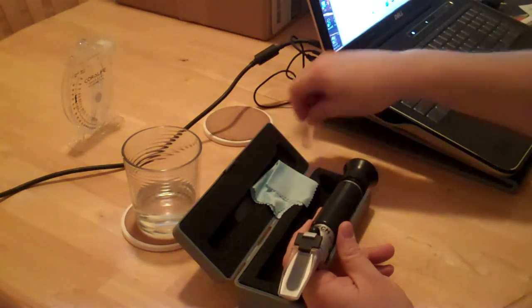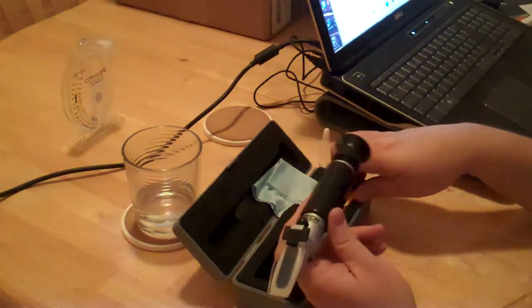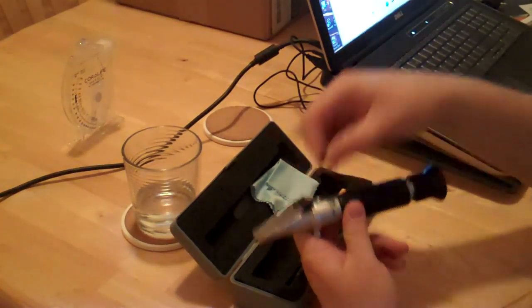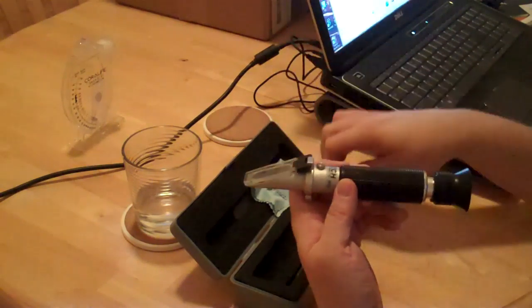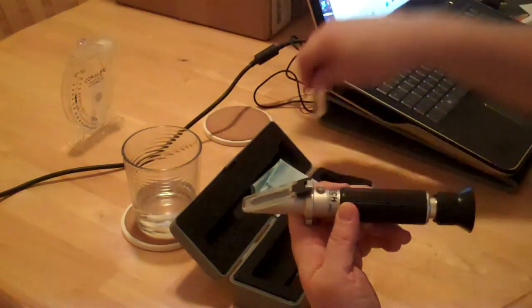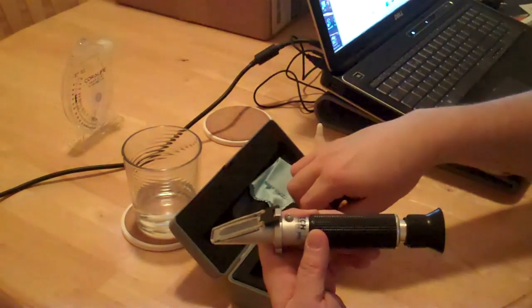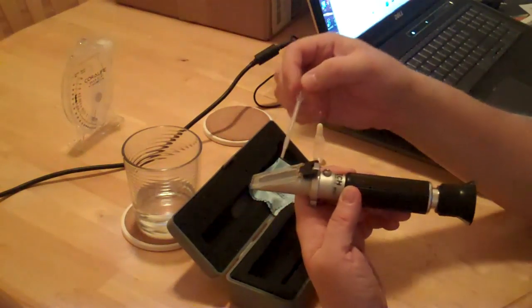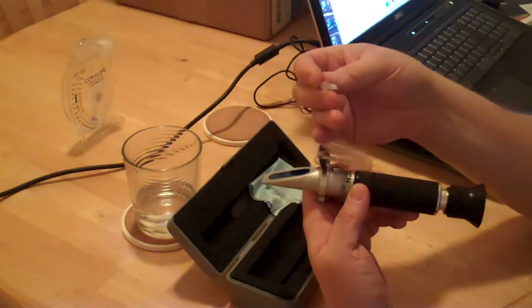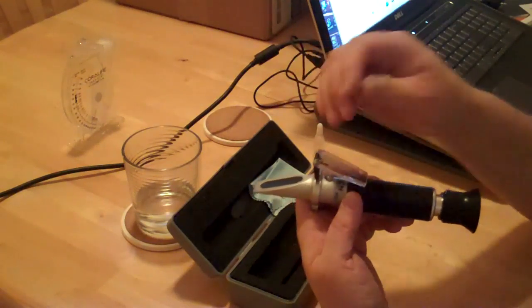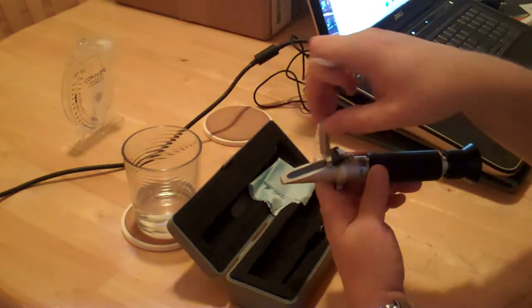When you get it, you have to calibrate it. That's easy to do. There's a screw right here. You use some distilled water. It comes with a little bottle and eyedropper. Put a few drops of water on the prism here and make sure it is even when you close the lid.